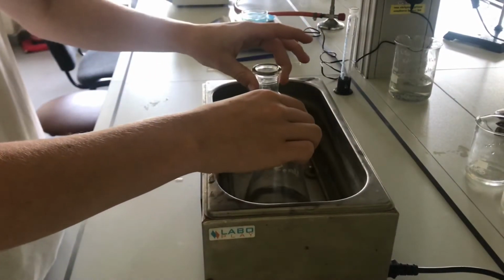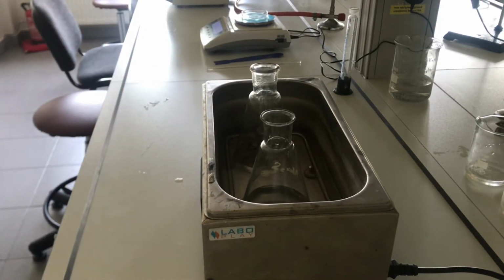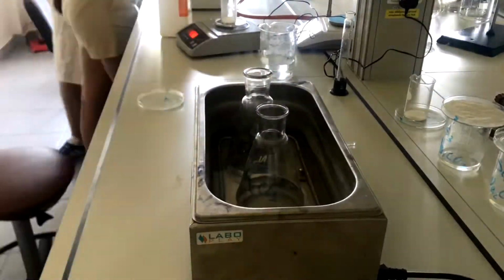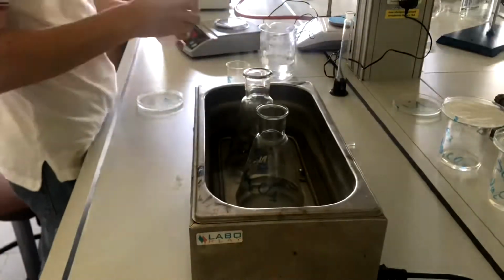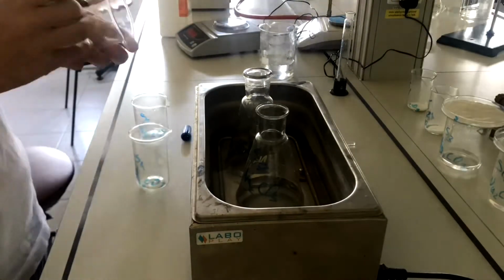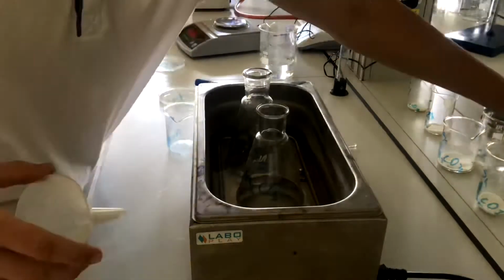It is then that I realized I had made a mistake. The flask I had taken was incredibly buoyant. I thought about how to stabilize them, but then I promptly dismissed the problem. Moments later, off camera, my flask floated a bit too high up and ended up tilting over, and the contents of it splashed into the container.